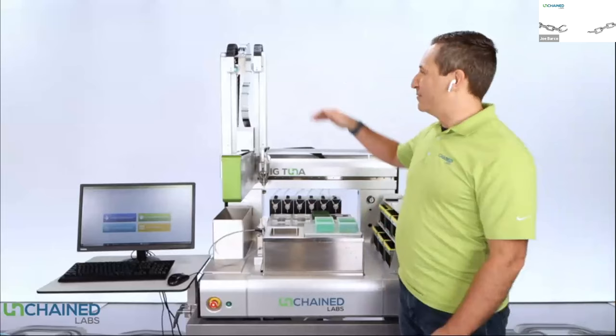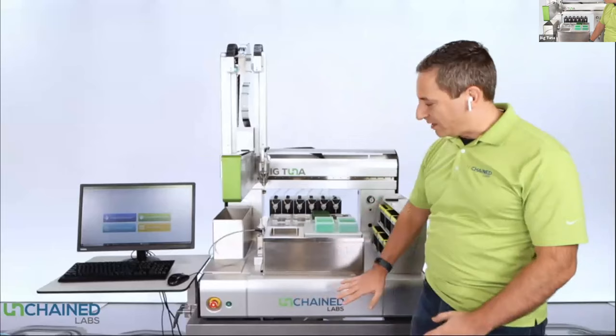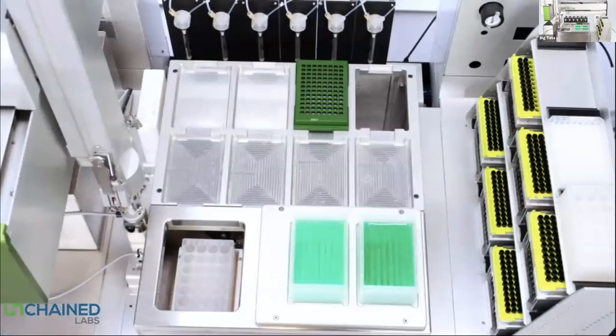Now that I'm back in front of the instrument, you can get a sense of the scale. It's about 1.8 meters high, about a meter long, three-quarters of a meter deep. It's on casters — about the size of a laboratory bench — so you can move it around. You need power and pneumatic connections. The chamber door just opened, so let's look at it from above.